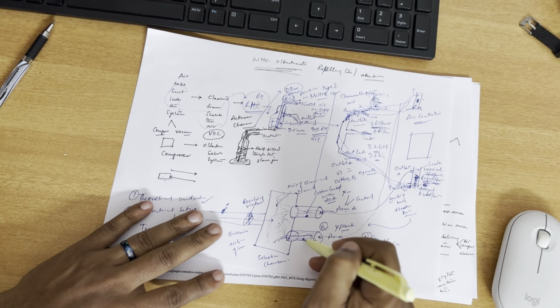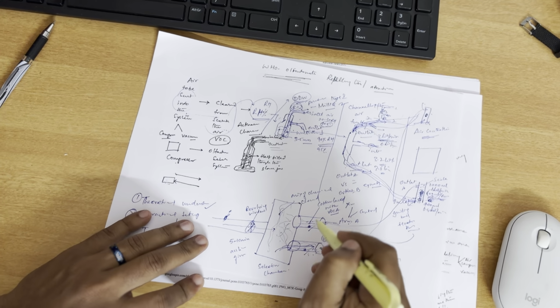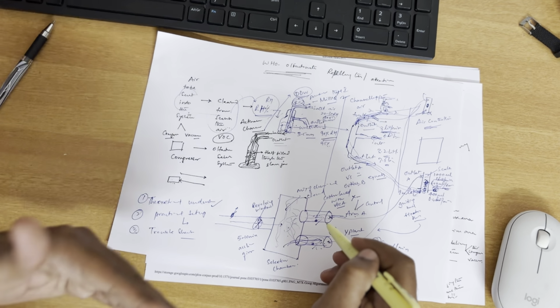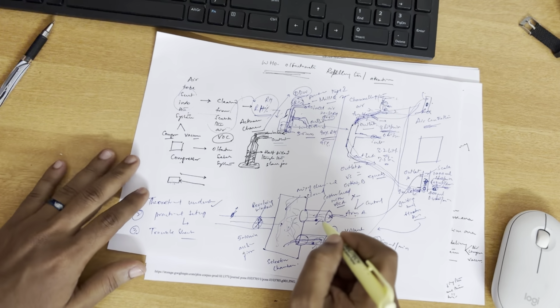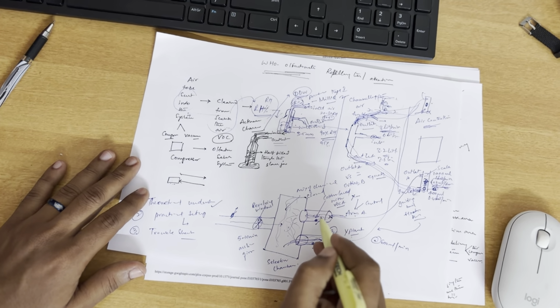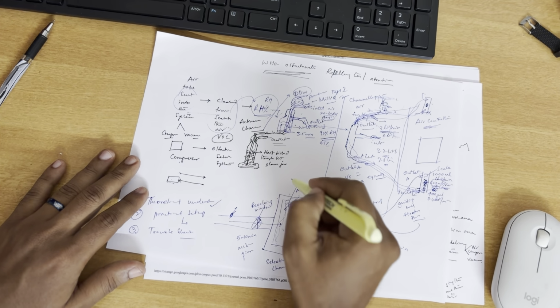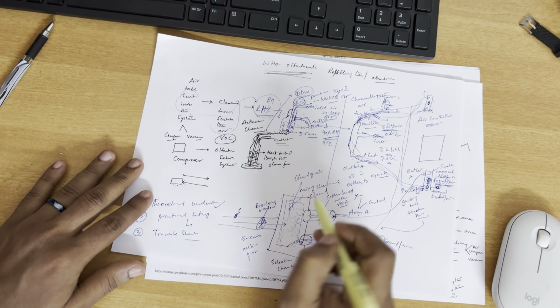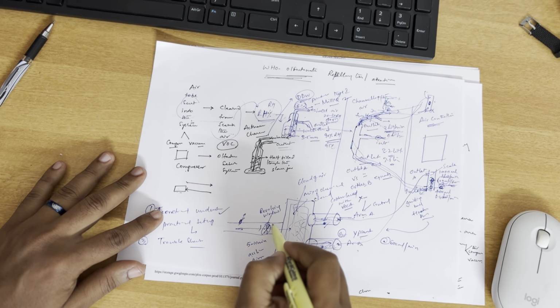In chamber A and chamber B, you will be keeping scent A and scent B. This doesn't necessarily need to be a control versus anything. You can use anything like 1 versus 2, or type A versus type B, or chemical versus plant A versus plant B. Now the controlled air is sent to arm A and arm B, and you will see here the cloud of air saturated in this area. The insects are held here for 5 to 10 minutes, and then you open the revolving door.